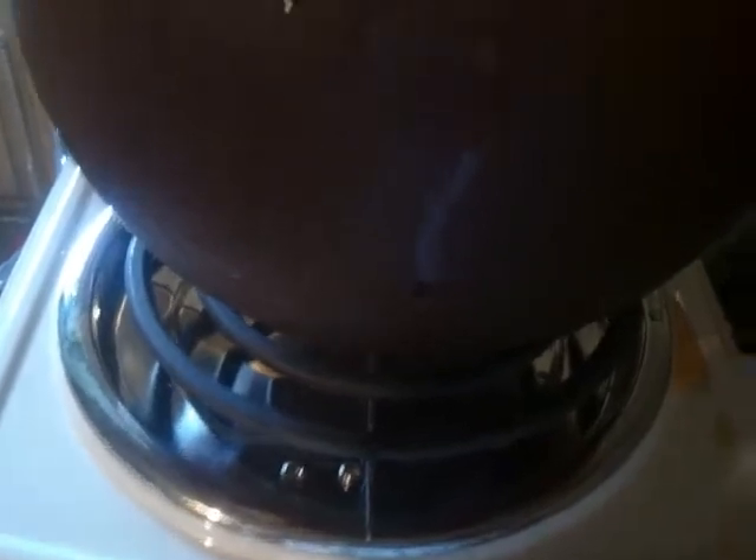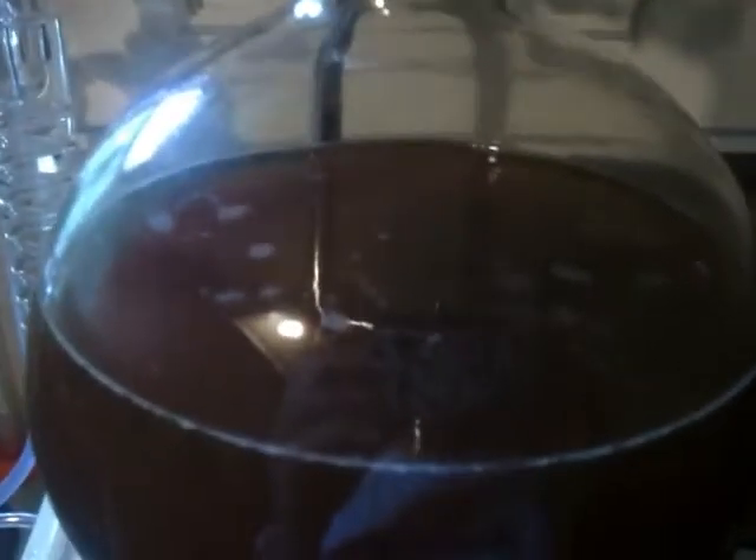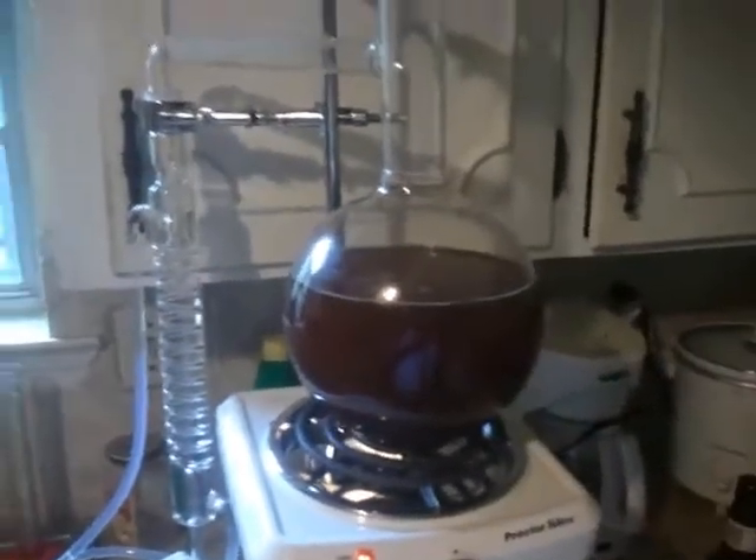About a half hour now — everything's cleared out. It's running with the condenser, dripping out now. There's a nice little convection going. The neat thing about these glass stills is you can see everything happening.